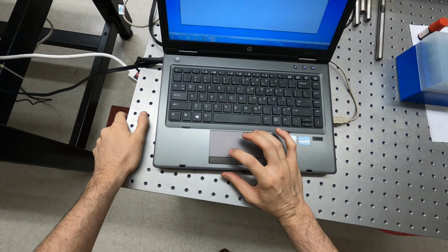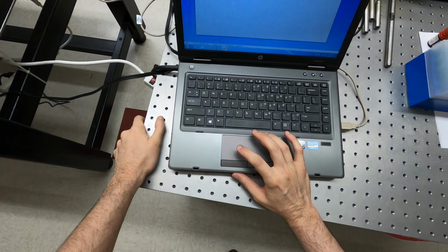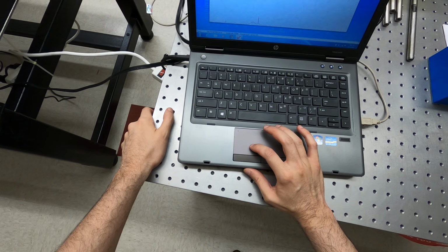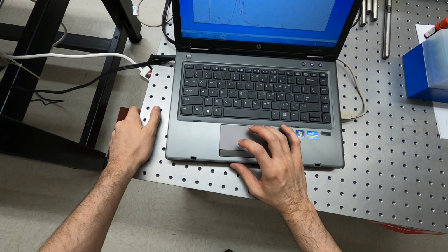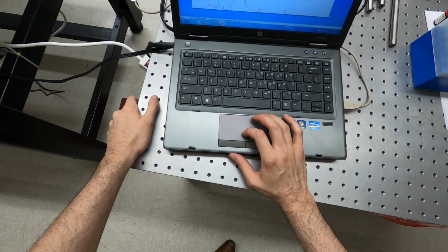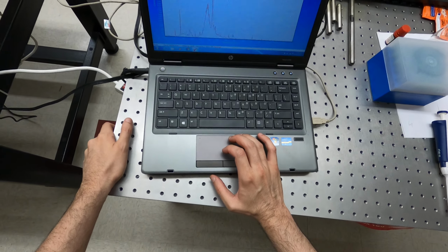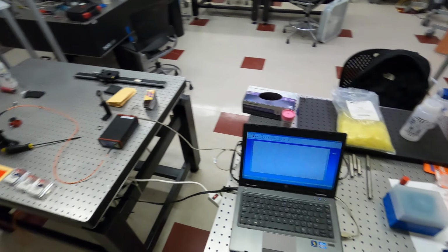Okay, so I can't observe anything. Let me increase the integration time. Let's say 50 milliseconds. Now I start observing something. Let me increase by a factor of 10 now. Okay. Now I see more. I see several peaks. And these peaks are due to the lights in the room.